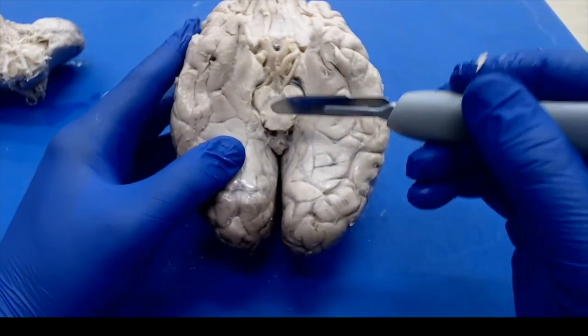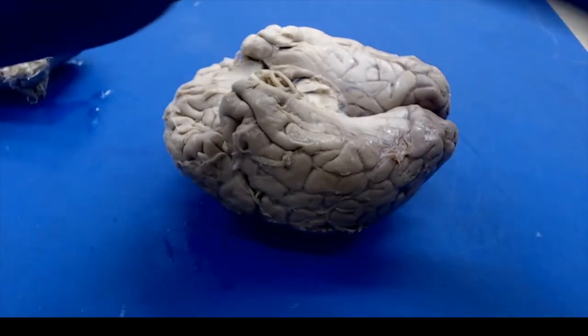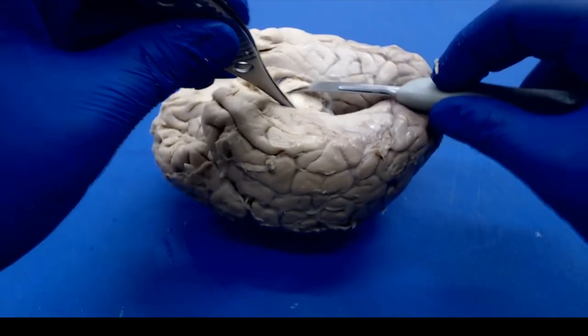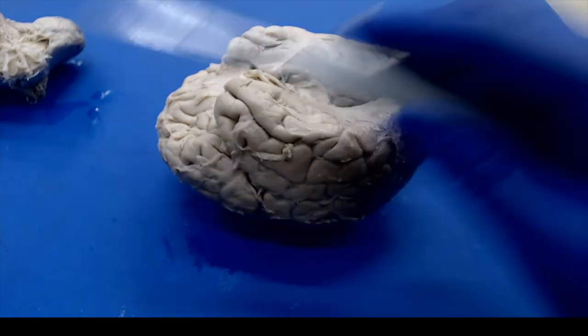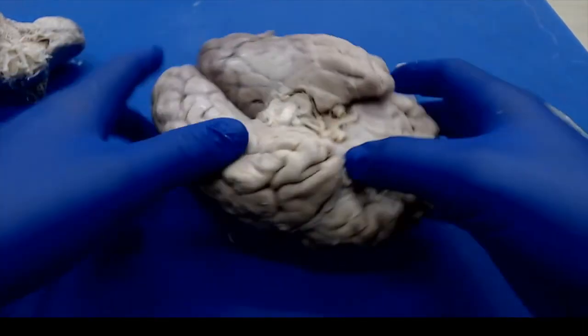I could go ahead and take my section here, which I might just do just to be done with it. And I already got this other one over here ready to go. So let's take a nice section. We'll save that for later. Now overall, there's 5 important sections that we're going to be taking, and that's one of them.